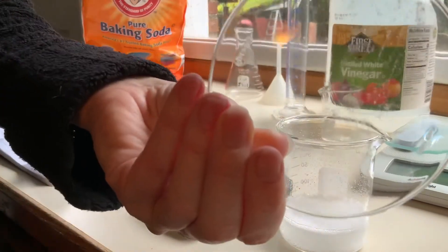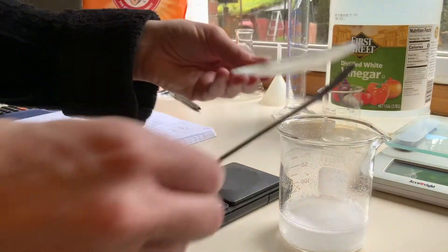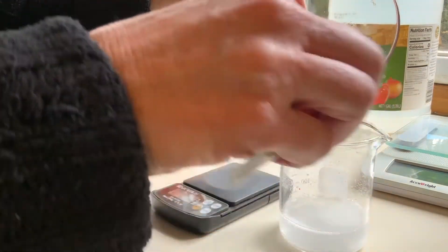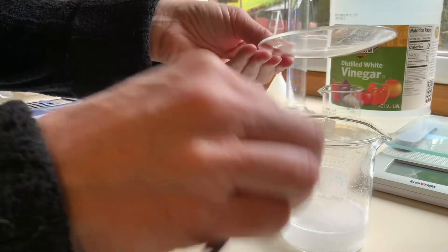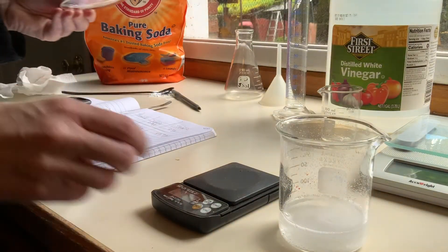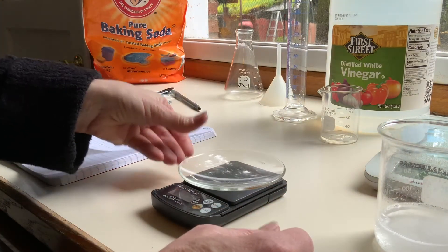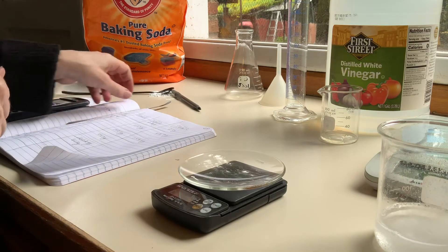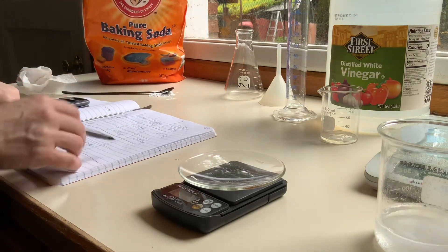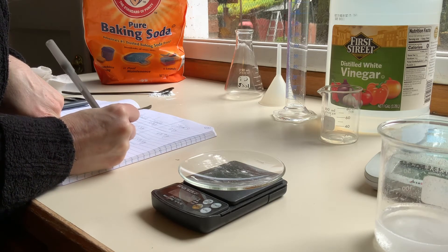You can see it's a little wet on the watch glass. I think that's alright because normally we'd have it all together and weigh it as one. So that water will be included in the mass — it was in there to begin with. While that reacts, I'll weigh the watch glass after: 55.6 grams. Mass of the watch glass after is 55.6 grams.